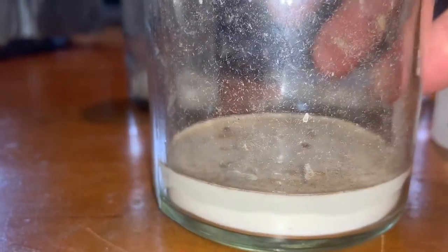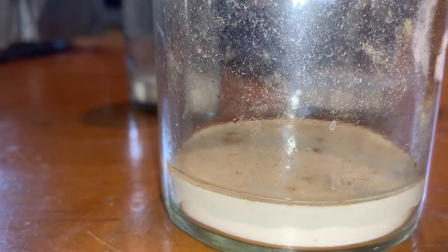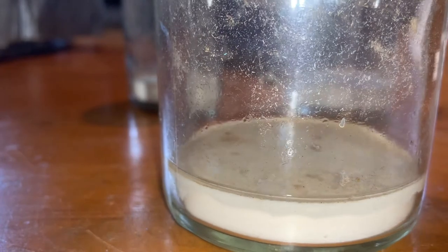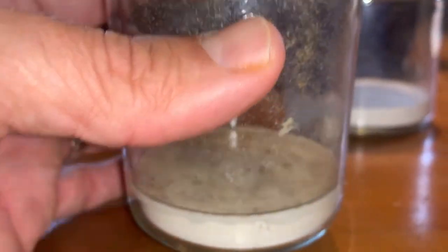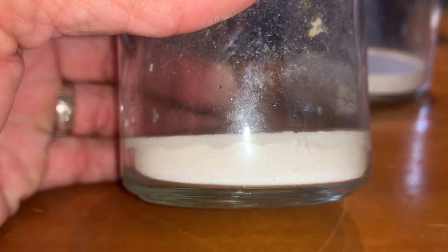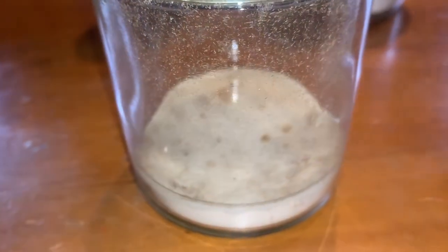I probably need to put a little more ethyl acetate in — in fact I want to put a little too much in to show you some do's and don'ts. As this jar is almost completely fully charged, we just want to make sure that plaster is completely saturated.